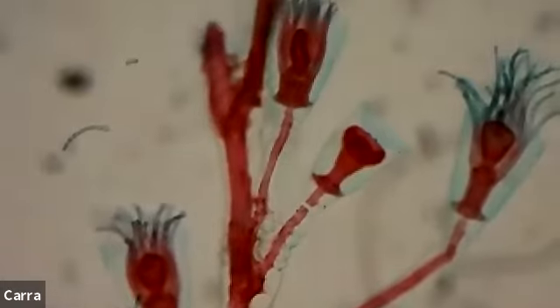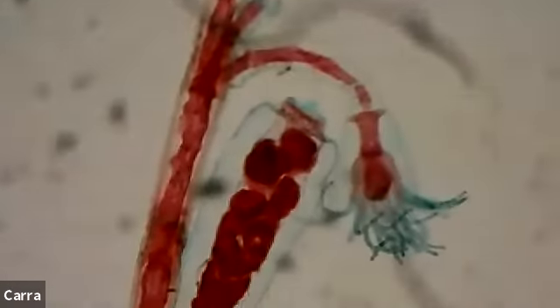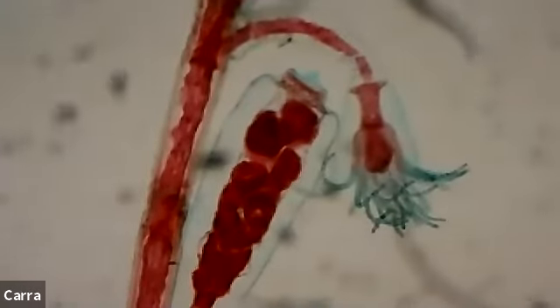So these are just really, I like it. It's confusing because it looks like a plant, but it's not a plant. Remember, it's an animal. So it's a cnidarian, and this is the polyp form, but these little polyps can separate from this colony and become lots of little medusas. Maybe one of my favorite microscope slides in the 1802 lab.